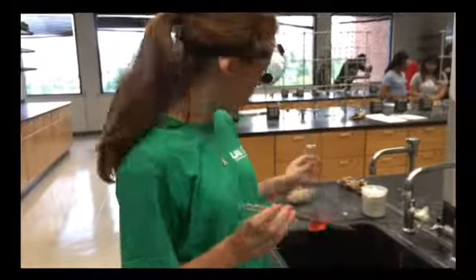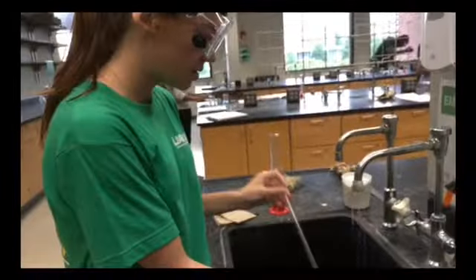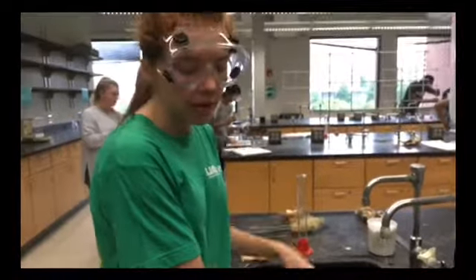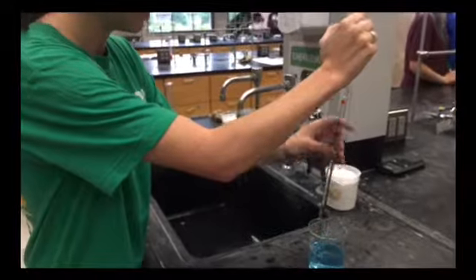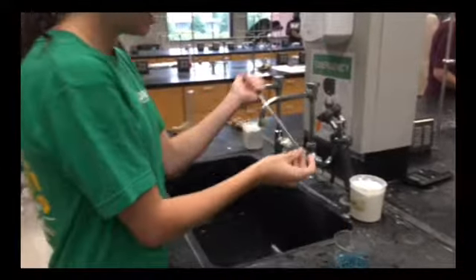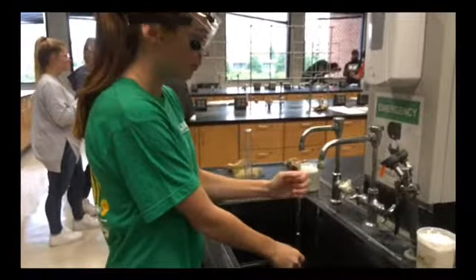We start by cleaning our vessels. We need to clean both our pipette and graduated cylinder with water and with our solution. We must fill it with water and flush 3 times, then with our solution and flush 3 times. A stock solution is a concentrated solution that will be diluted to some lower concentration for actual use.